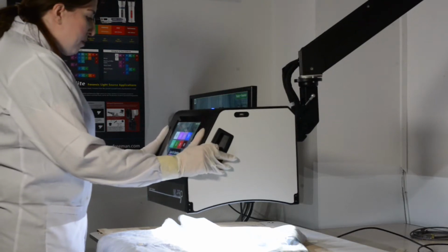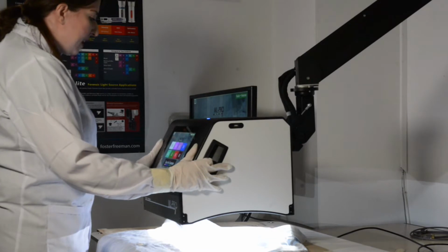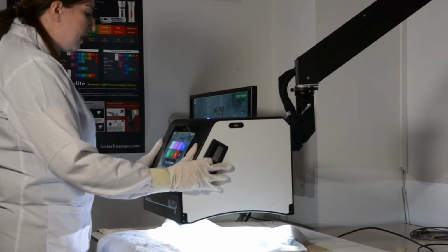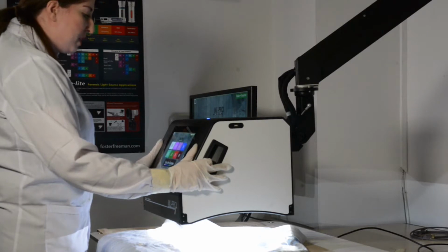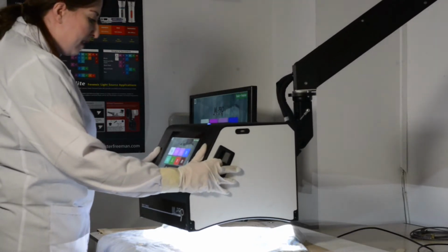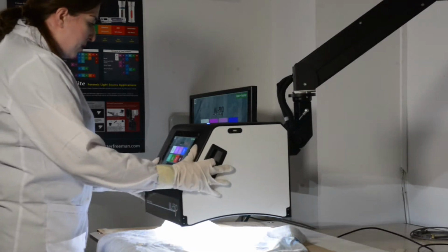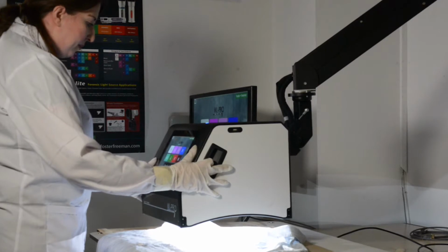The ML Pro is a brand new light source designed for laboratory use. It contains a range of wavelengths of light, from white light, UV, through the visible and into the infrared, so it gives you full spectrum analysis. In this example, we're going to have a look at some accelerants on fabric.